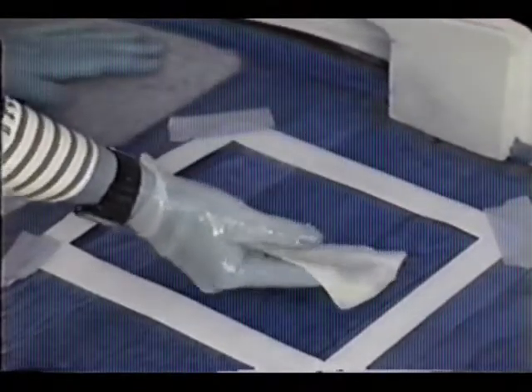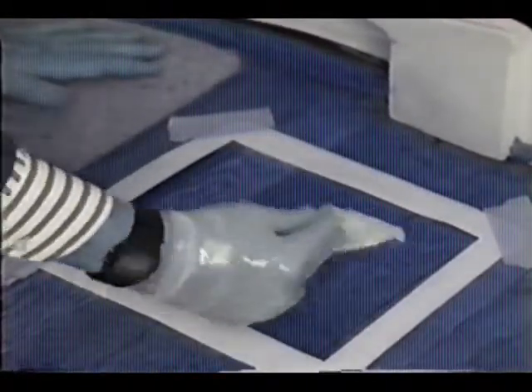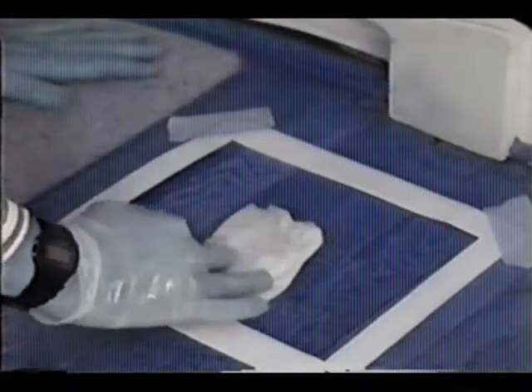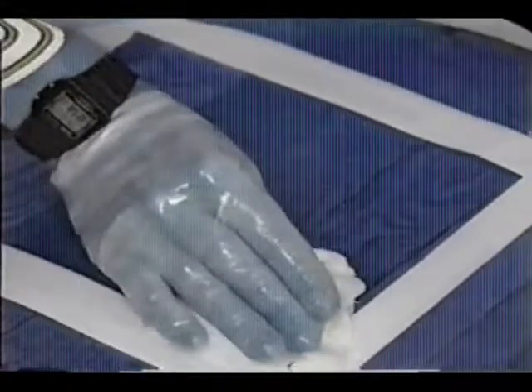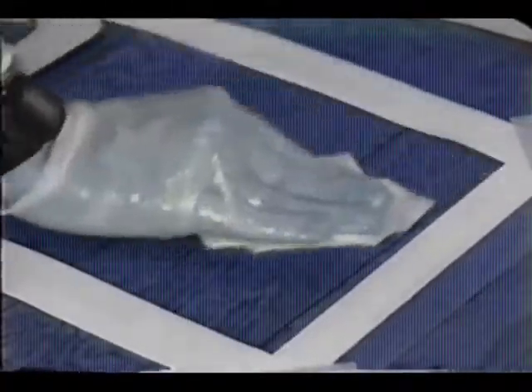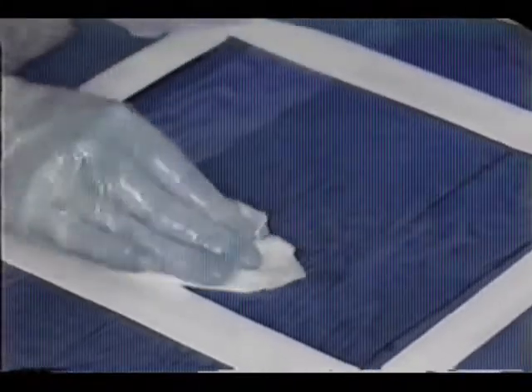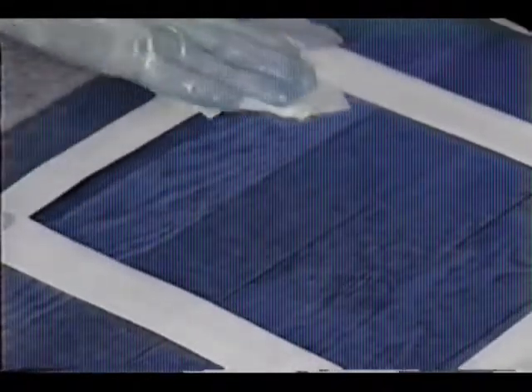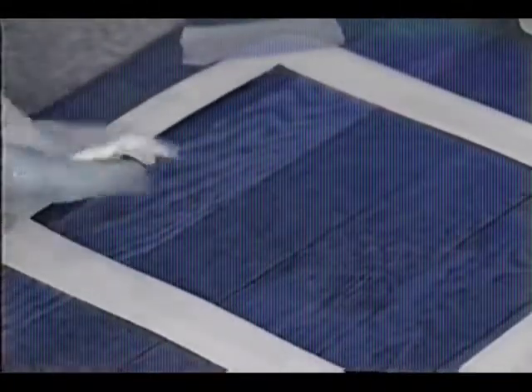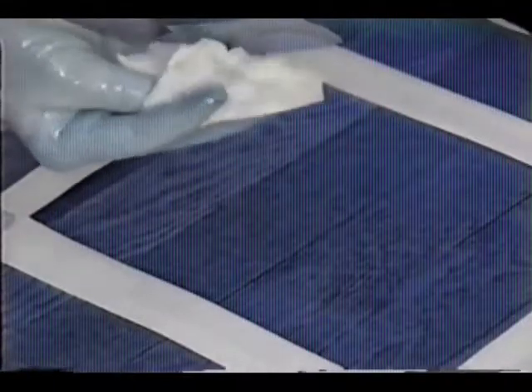Lay the wipe on the test area, contaminated side up, and fold the wipe in half so that the contaminated side faces inward. Do not touch the contaminated side. Place the wipe in the top corner of the wipe area and wipe the entire surface from top to bottom with S-like motions. Again, do not leave the boundaries of the tape or template and remove all visible dust, debris, and paint chips in the wipe area.